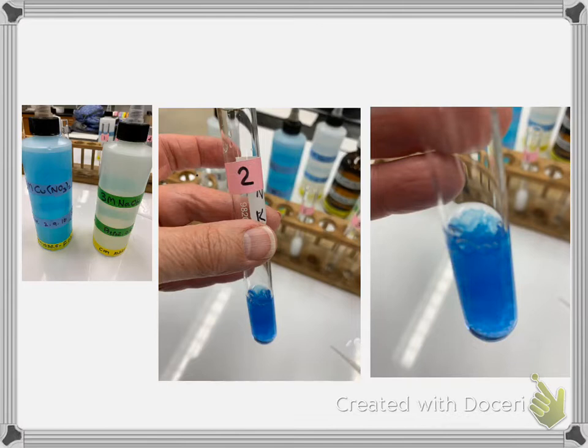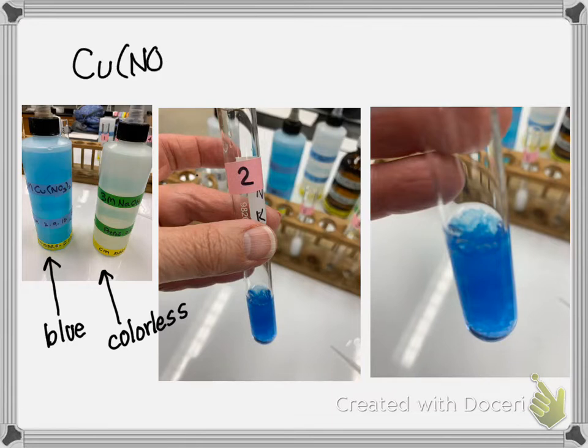The second reaction, well, we do see here you're starting with a blue solution, and this one is a colorless solution. Clear, again, describes when there's no particles there. So this has copper nitrate, which again is a solution that's blue. It's aqueous. And we're adding it to the sodium hydroxide.